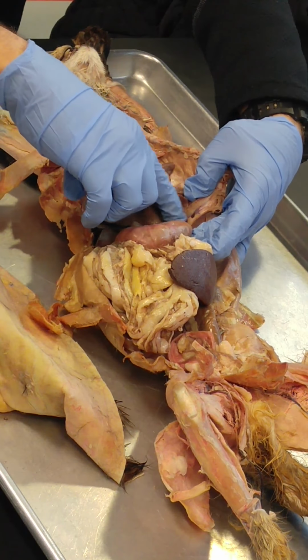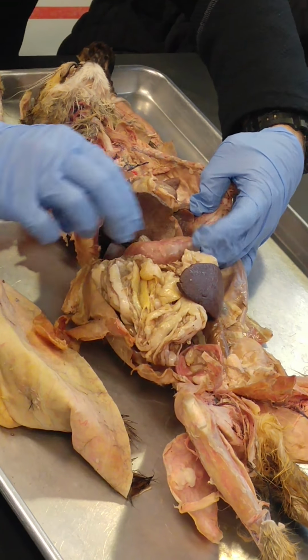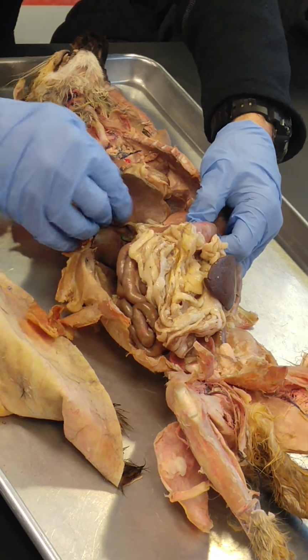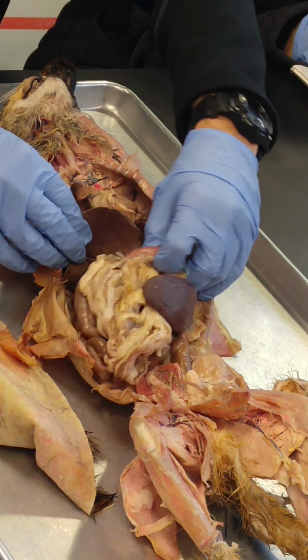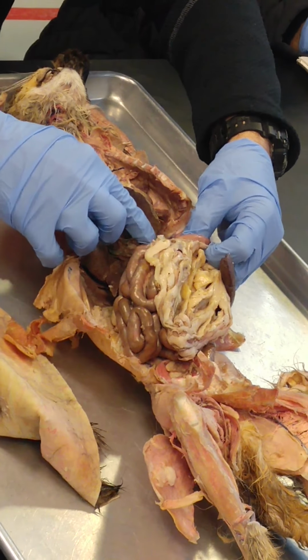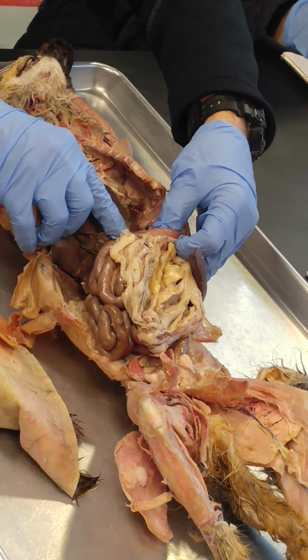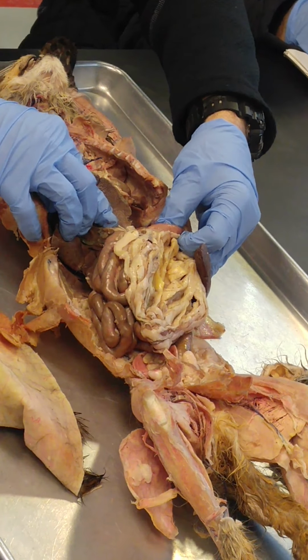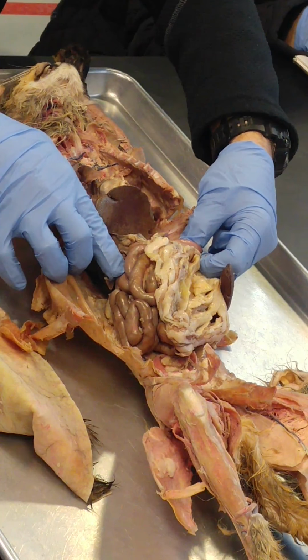The fundus is this curved portion that kind of sticks up above the cardia. The body is going to be the central portion. And then it'll transition into this narrow region right here that we call the antrum. And then finally the pylorus and pyloric sphincter. The pylorus is this area right here, the lower part of the antrum. And then the pyloric sphincter is the sphincter that separates the stomach from the first part of the small intestine, which is the duodenum.